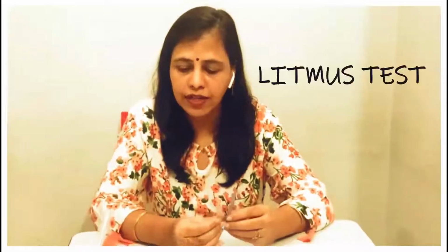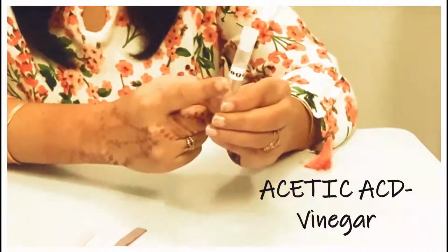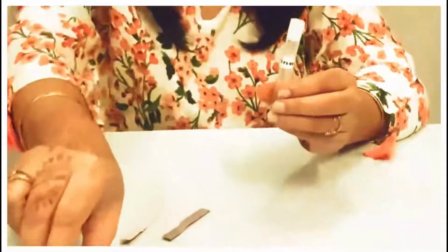The second indicator which I will take today is litmus. It is also very well given in your textbook. So I have taken two litmus papers, blue and red. Now let us see what is the change of this blue litmus paper in the given samples. For acid, I have taken the sample of acetic acid, commonly said as vinegar. And for base, let us take the same detergent powder.